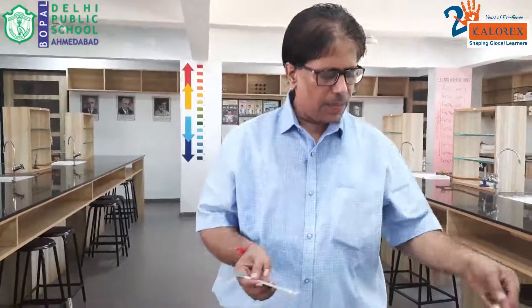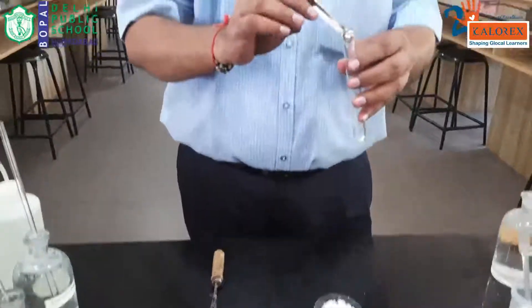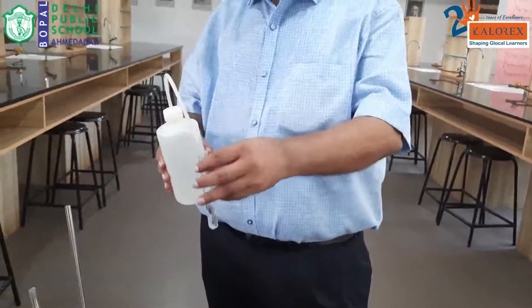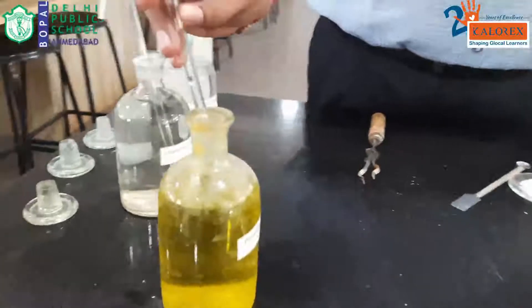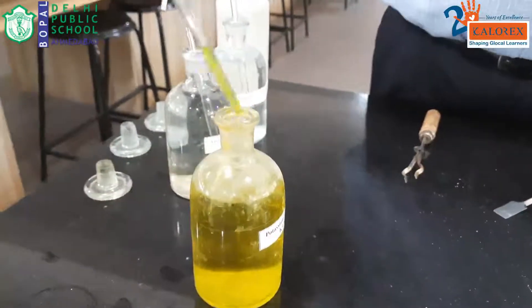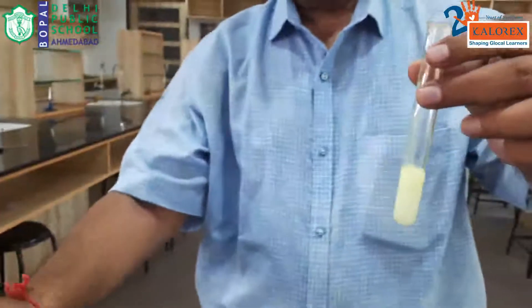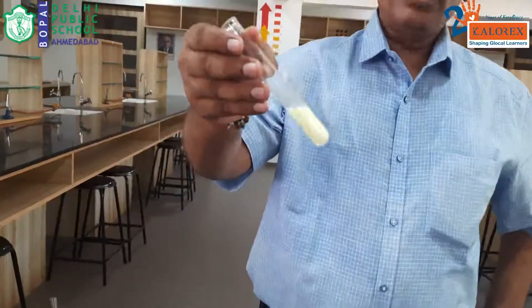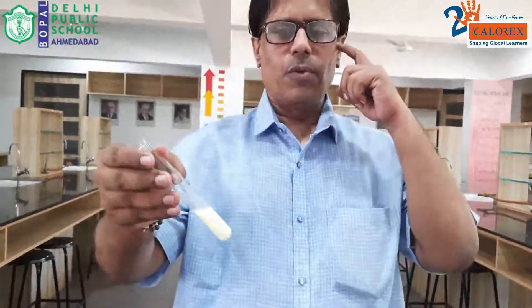Let us begin with the barium test. Preparing the aqueous solution of the salt and adding potassium chromate to it. Look at that — we are getting yellowish-white precipitates. This clearly indicates the presence of barium ion, Ba²⁺. These precipitates are barium chromate, BaCrO₄. Since barium is confirmed, we do not need to test for strontium or calcium. Barium ion is confirmed with potassium chromate.